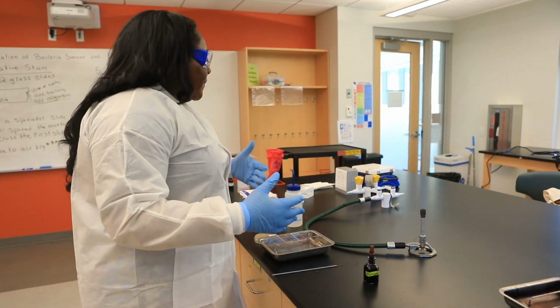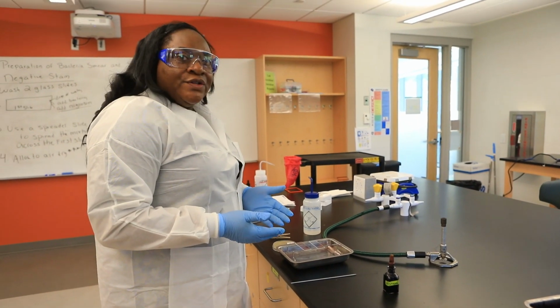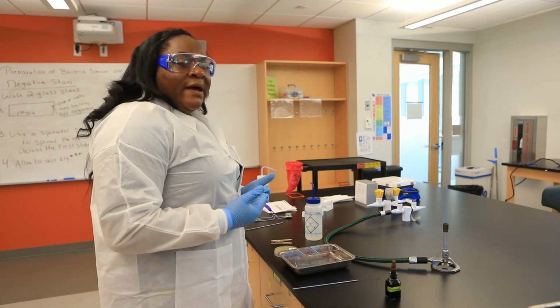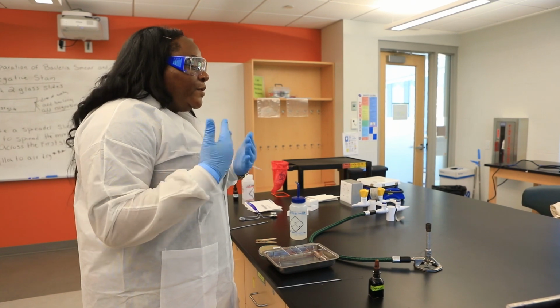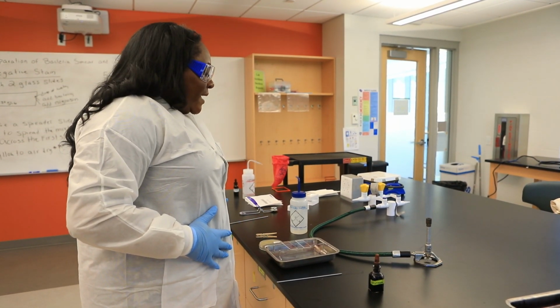So let's first talk about what you should do before you actually conduct the stain. You should disinfect your work area with 70% ethanol. You should make sure that you have the proper personal protective equipment. So I have my gloves, I have my goggles, which I also disinfected with 70% ethanol, and then I have my lab gown, okay?